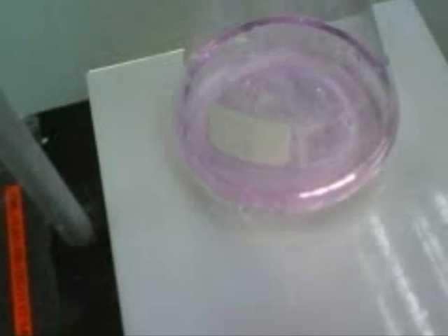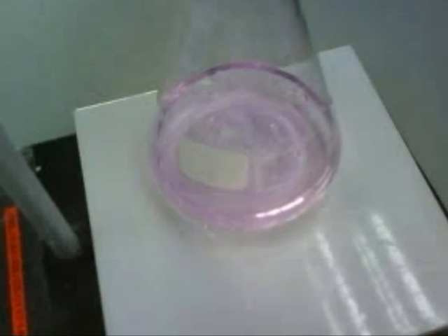You should try to add base until the color of the solution just turns pink. One single drop.